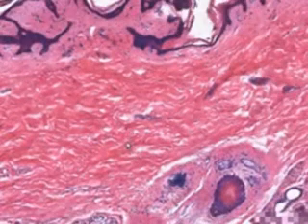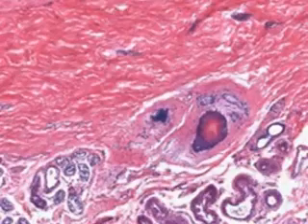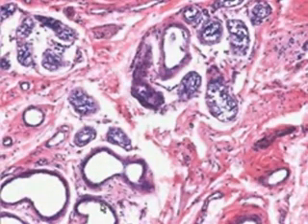Let's look at the types of sweat glands that we didn't see before. Whereas we saw these eccrine sweat glands, which we said were basically small tubules and ducts, this being a duct and this being an acinus, or the secretion part of the gland, the apocrine sweat glands, like you see here, are much larger and more irregular. And of course these are not blood vessels, because when you go down on them you can see that they are lined with true epithelium, like you see here, and not endothelium.